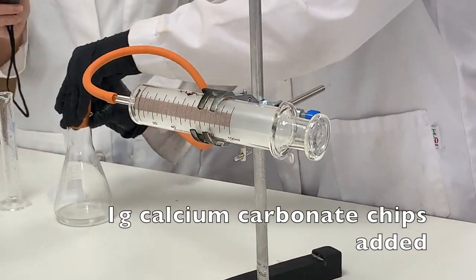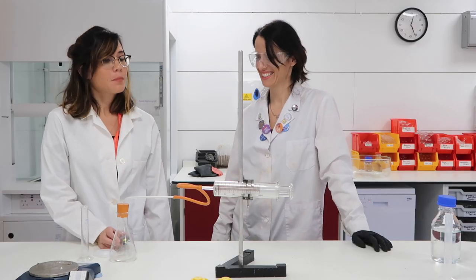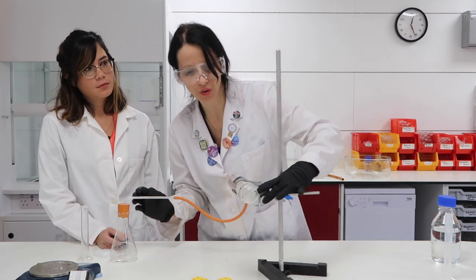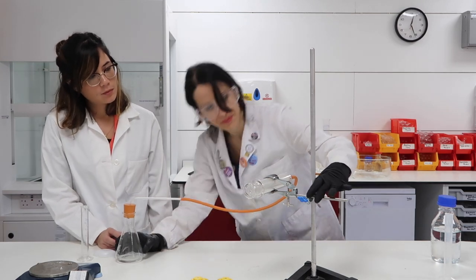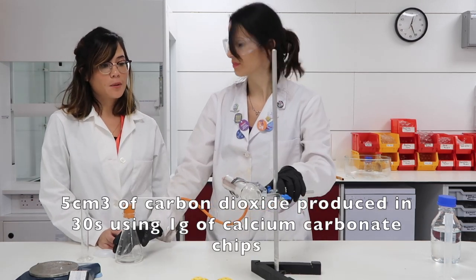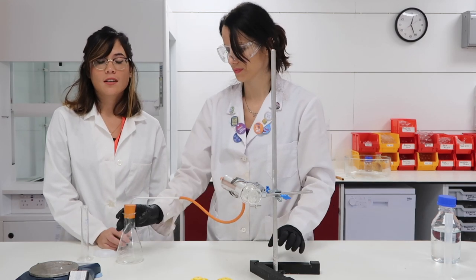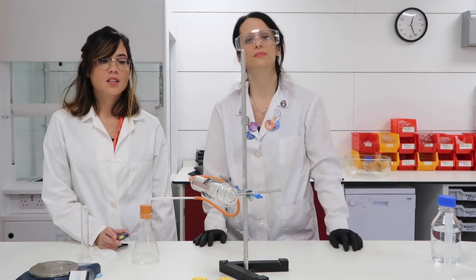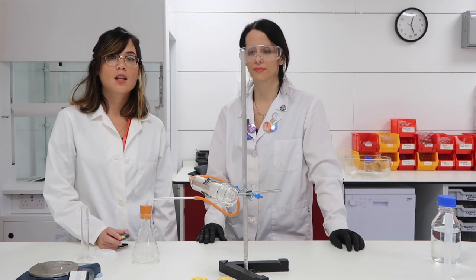Stop clock started, waiting for those 30 seconds. Okay, 30 seconds. This time the volume is 5. Wow, it's much slower — really slow. As we would expect, the smaller surface area of the large calcium carbonate chips has meant that the volume of carbon dioxide produced in 30 seconds is much less than that with the powdered limestone.